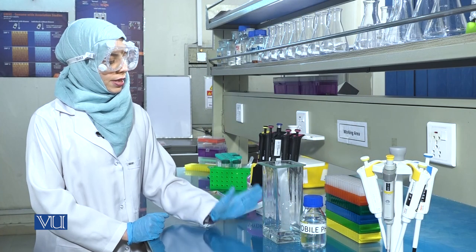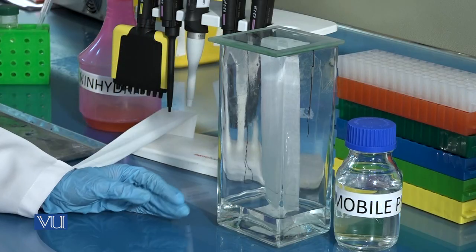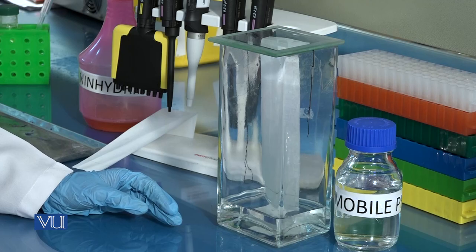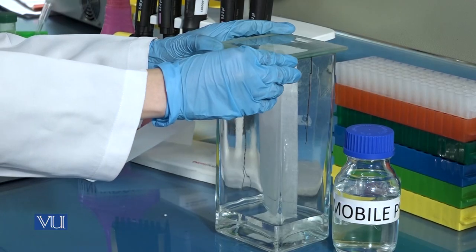After about 60 minutes, you will observe that the solvent has risen to approximately two-thirds the length of the filter paper. At this stage, carefully remove the filter paper from the chromatography tank.